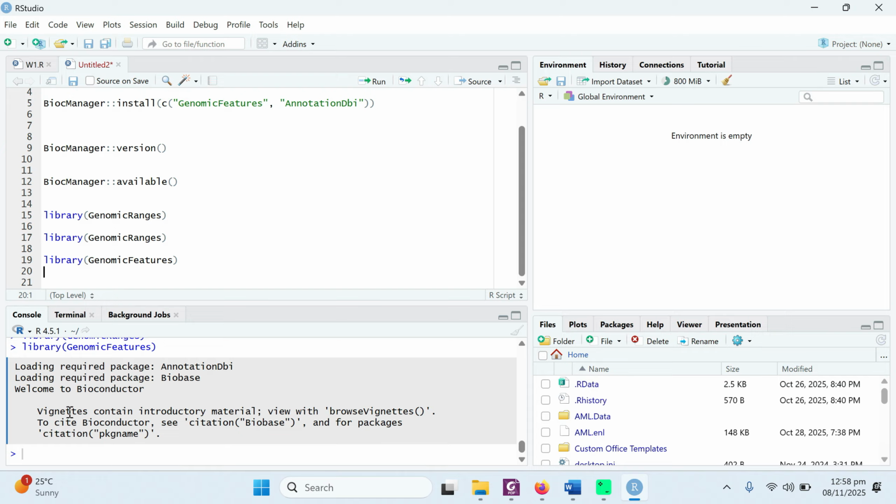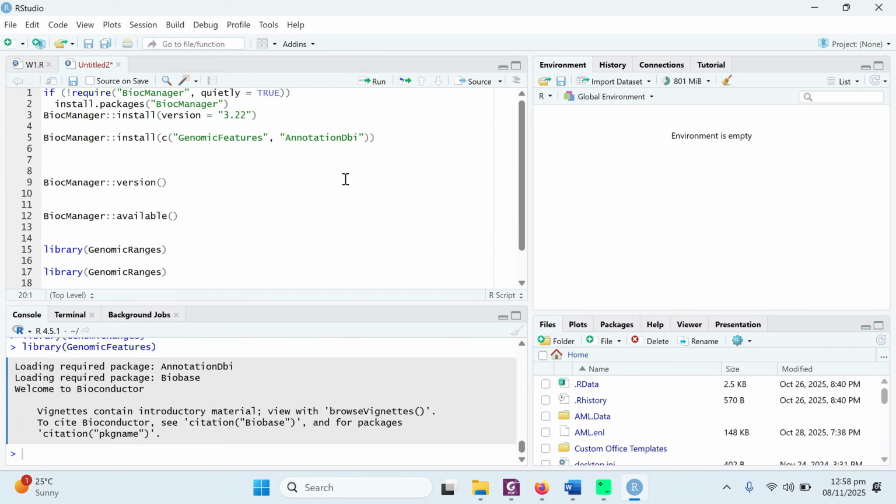So this is the basic and the simplest way to install Bioconductor. Just for a quick overview, first of all we installed R, then we installed Rtools, then we installed RStudio, and after that we used these commands for installing Bioconductor. So this is all for today. From the next lecture we will carry out different analyses with GenomicFeatures, GenomicRanges, IRanges, and we will show you how you can perform DNA sequence analysis using Bioconductor with R.